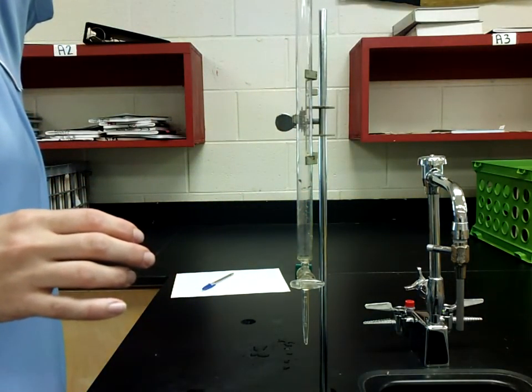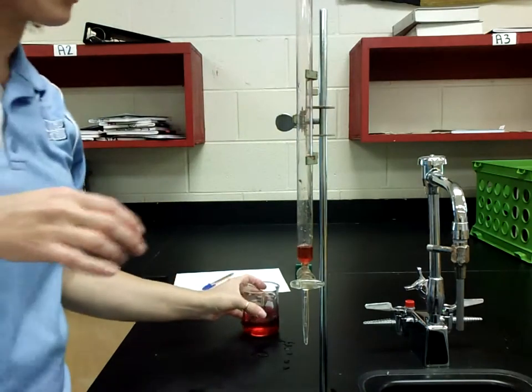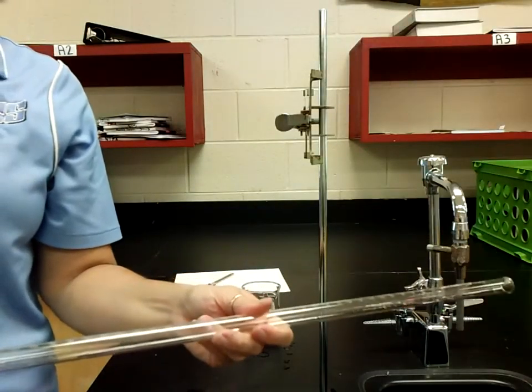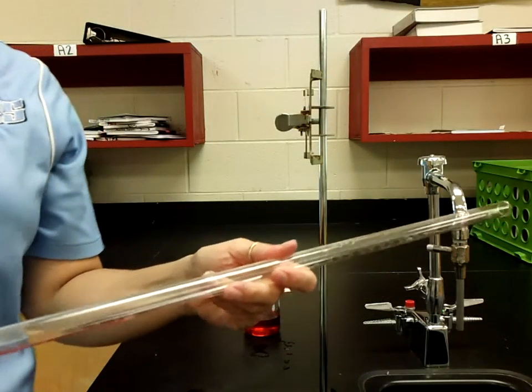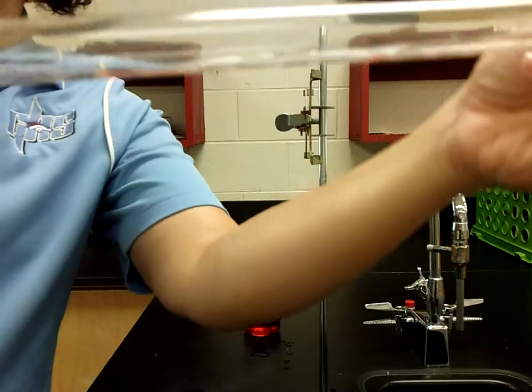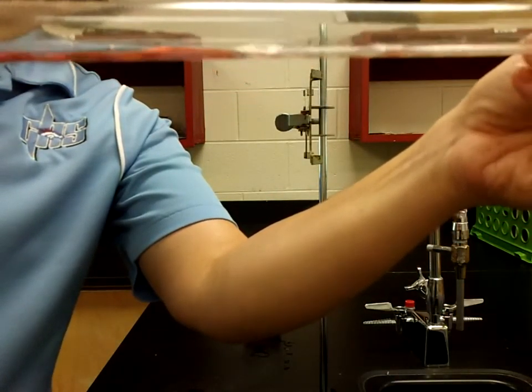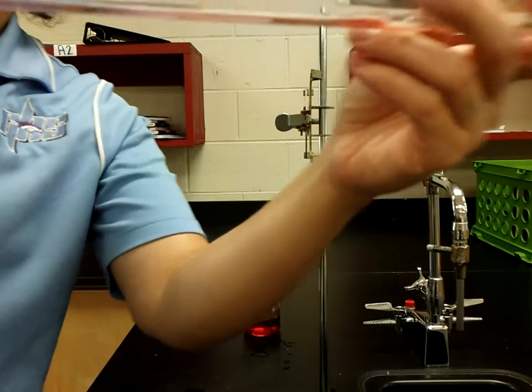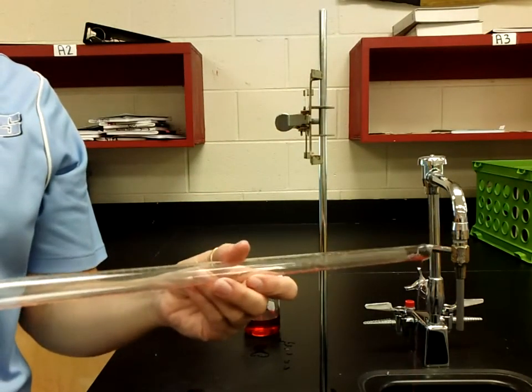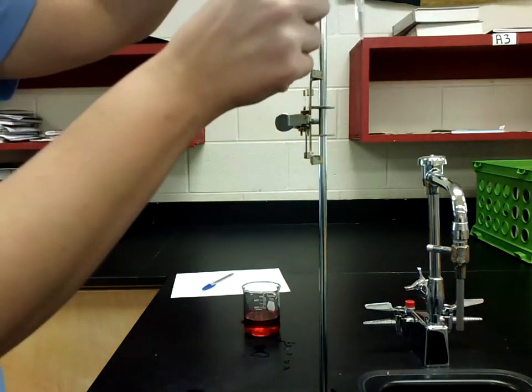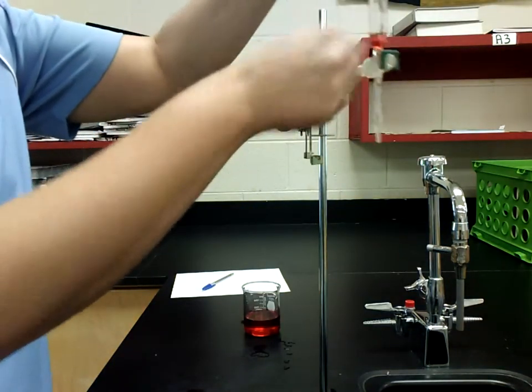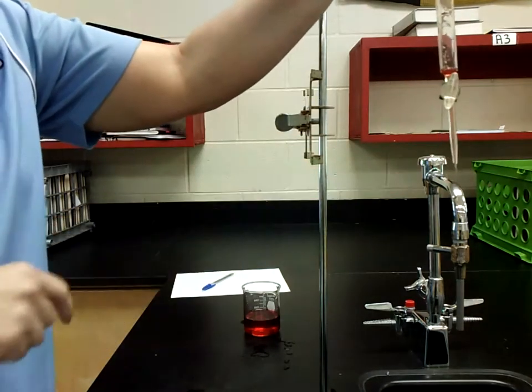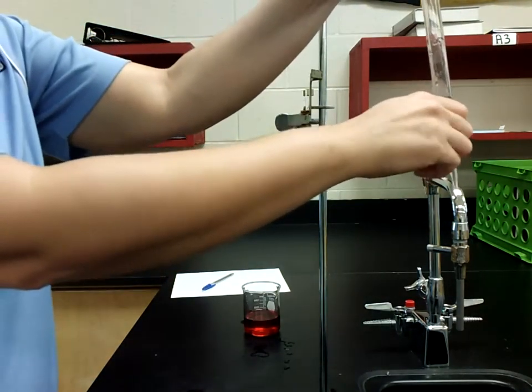So I'm going to use red liquid just to make it easier for what you see. You're going to go ahead and pour a little bit in through, and we're going to clean it just like we did with the DI water. So I want to make sure that as I'm tilting, I'm kind of rotating, and so my liquid is kind of getting moved around in there, and I'm rinsing off the sides all the way to the bottom, and then you obviously want to hold this over the sink so it all goes through there.